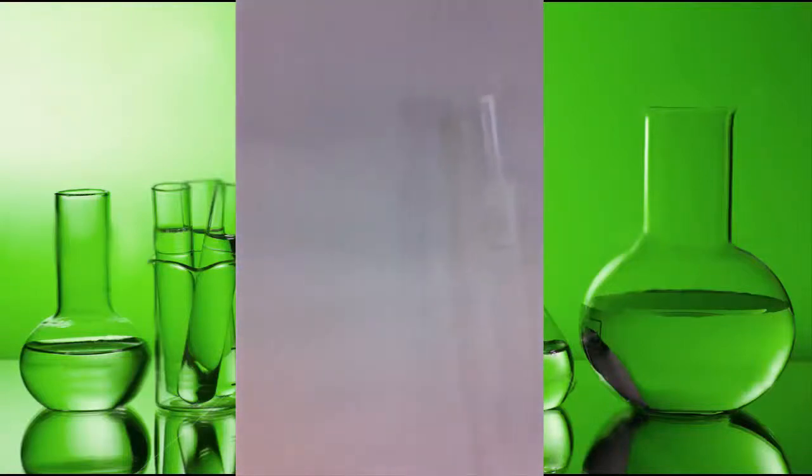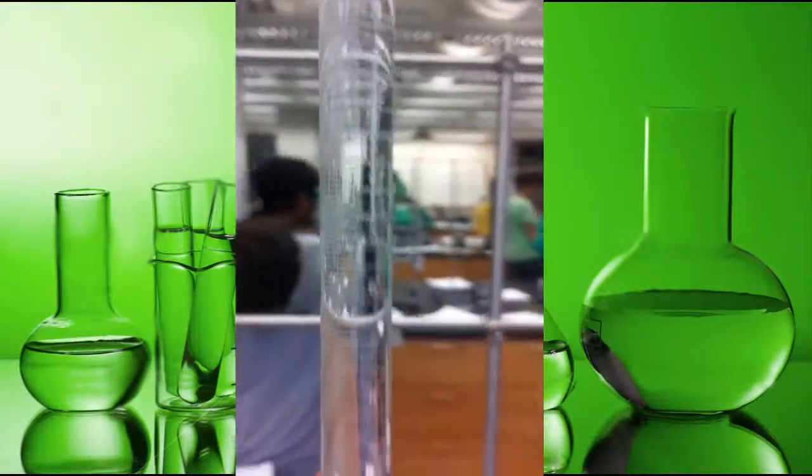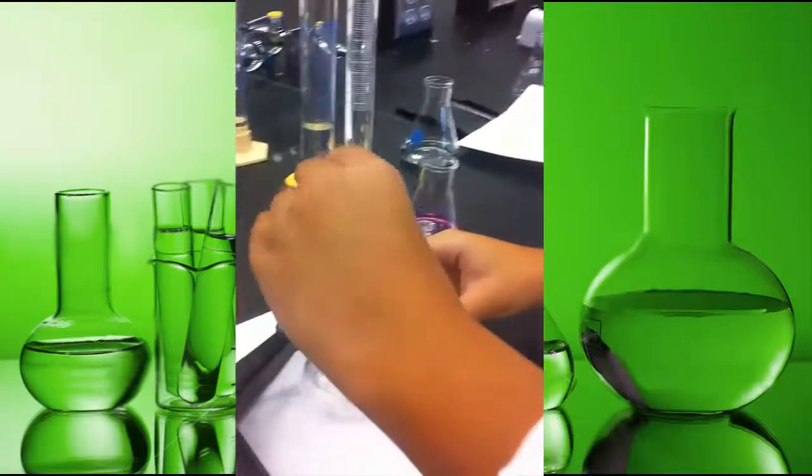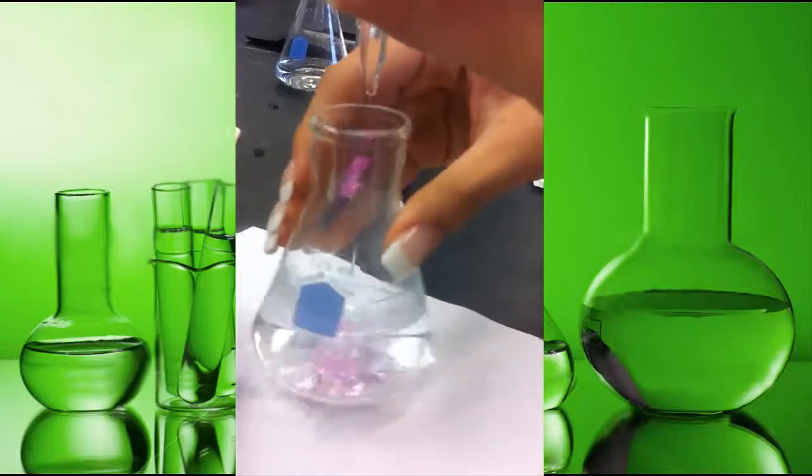Here we have another student. She finds her initial volume and then she begins titrating. Again, she constantly swirls the flask.